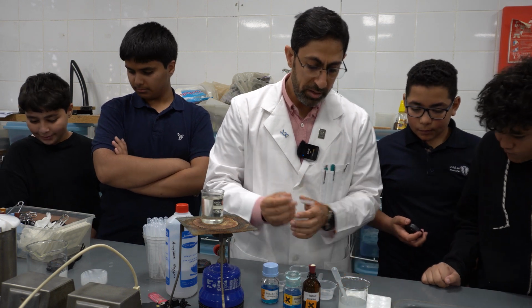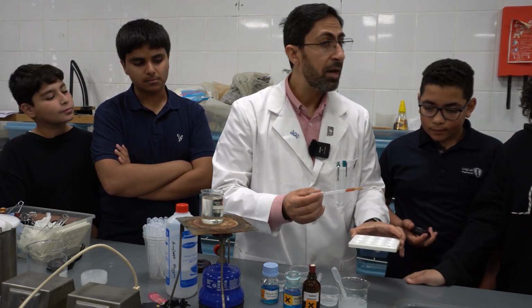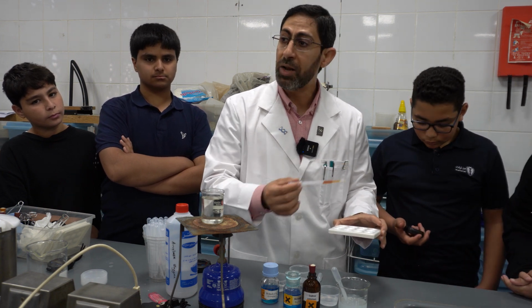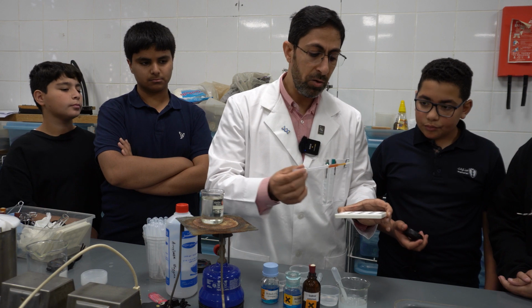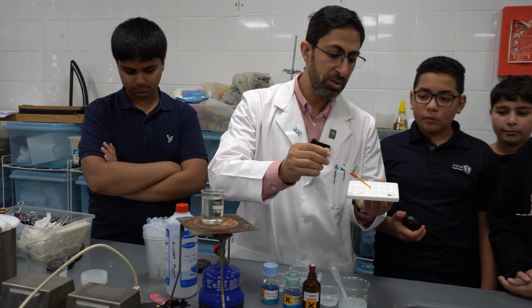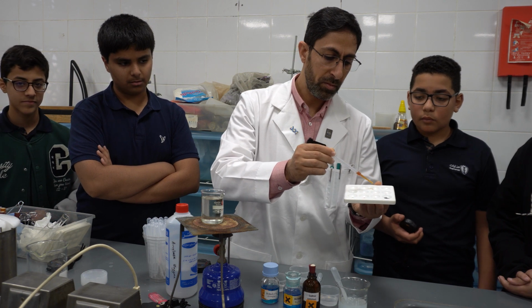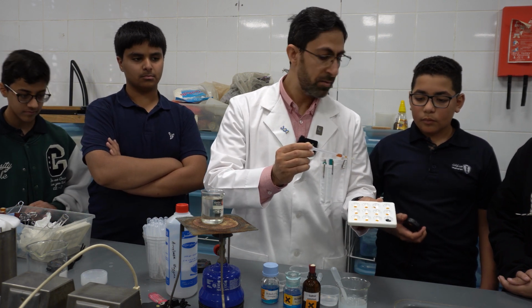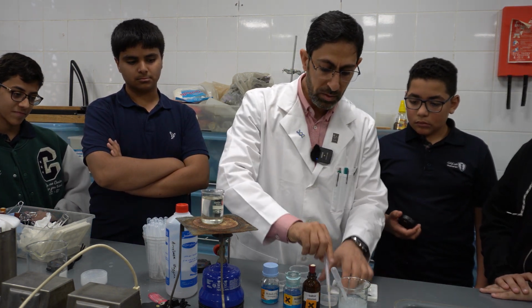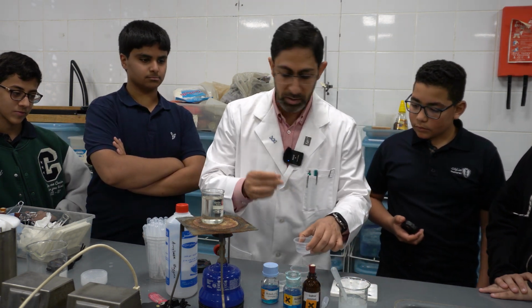Now, we will take a sample of the starch and add it into different spotting tiles, and at every 30 seconds, in consecutive intervals of 30 seconds, we will add the enzyme amylase. In order to do so, we will drop one drop of iodine in each spot. As you can see here, we don't need that more. Here we have the sample that we have now confirmed is starch.